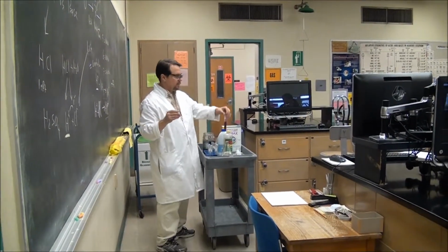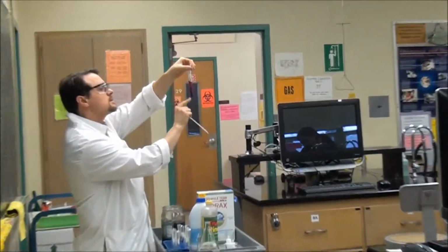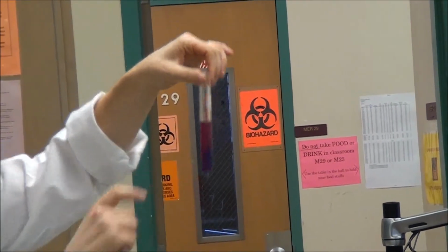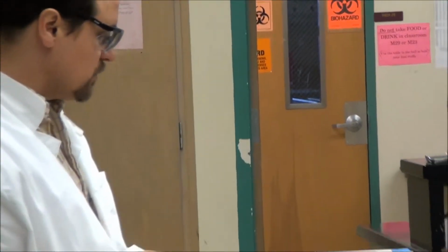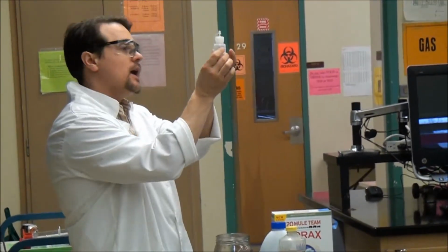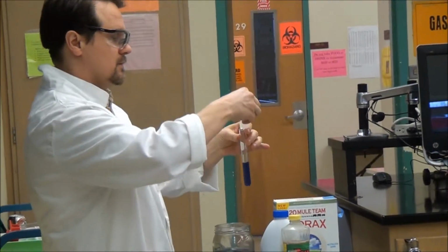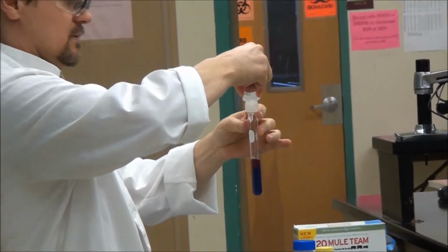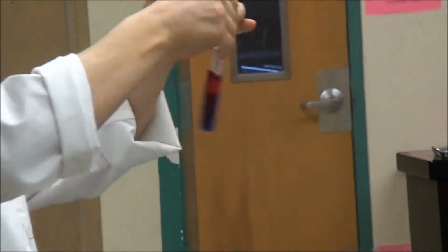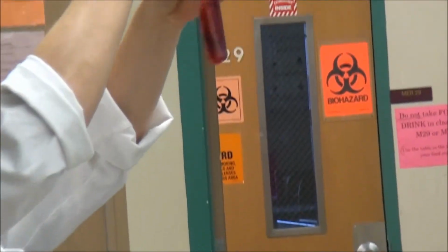So you can see right away there's a color change, see that? And so the acetic acid, this is what you should see with an acid. The acetic acid is a weaker acid. We could take a stronger acid, we'll probably see a more red color. I have actually hydrochloric acid here. So the hydrochloric acid, I'll just pour some in. So much less, it was just a few drops, but you'll notice I get quite a brighter red color.